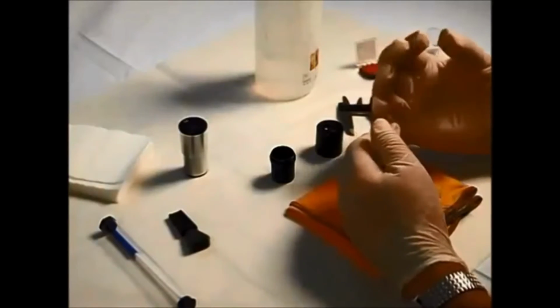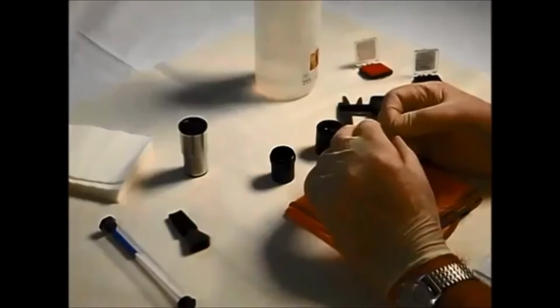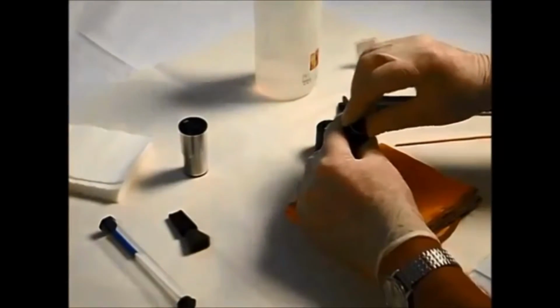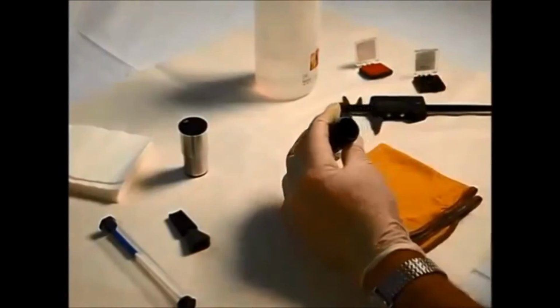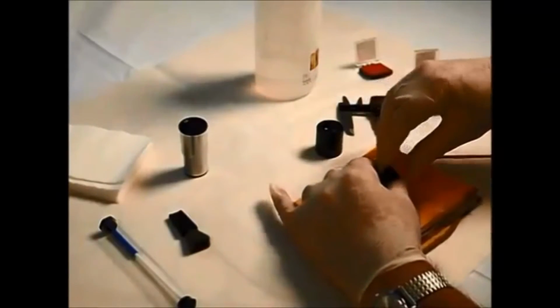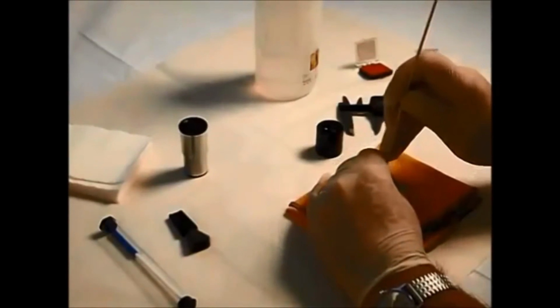Now a case of working out which side. This is a horizontal scale, 10mm scale. Which side the chrome of the glass is on can be difficult to work out. A little bit of trial and error can help, but I can see it's actually on this side. So we need to put this looking down through the tube this way round. There we go. So that's fitted in there, seated in there. Again, as you saw on the last one, we're going to use a circlip to hold this one in place. This one's actually a circlip with a pointer, but I probably wouldn't use a pointer one normally, but there we go. So a circlip in here.